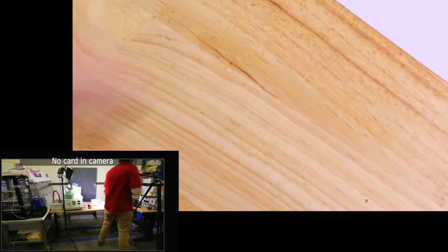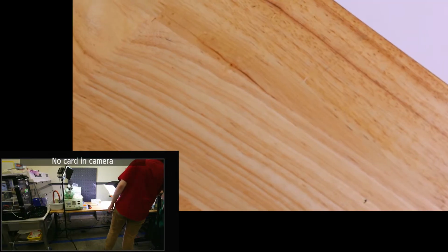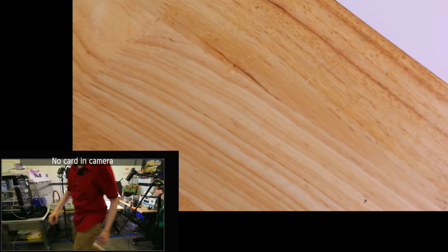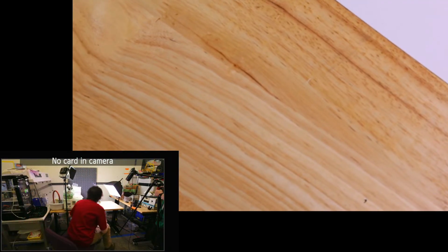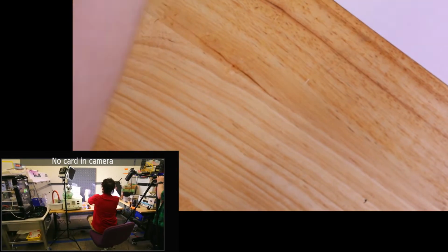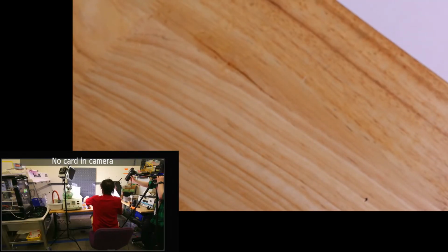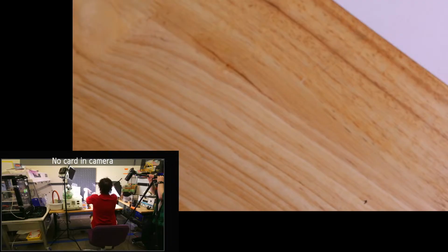So are we looking good on exposure? I think we're doing decent. We'll go a little bit less. There we go. So let's throw some gloves on. Touch the fingers on that one. Got more than we bargained for there.